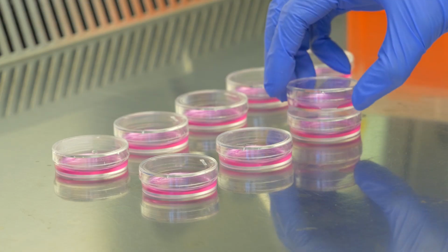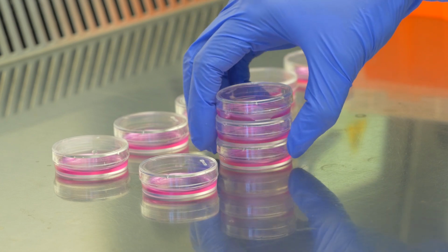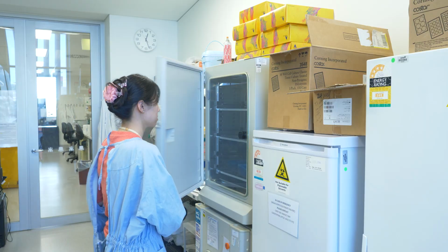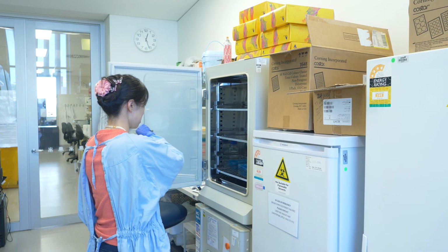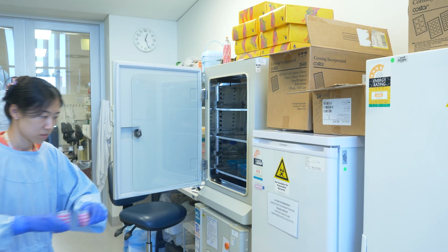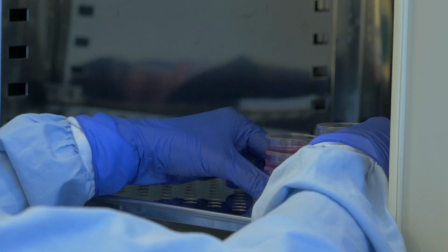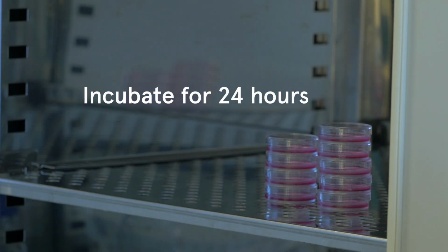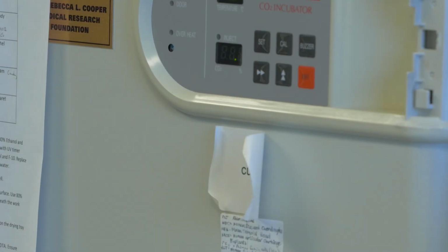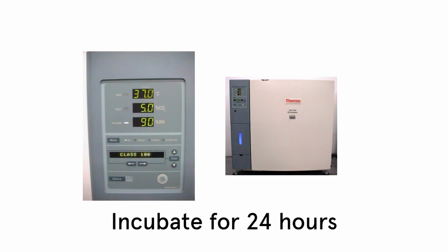Next, the prepared dishes will transfer to an incubator. The CO2 incubator is an essential piece of lab equipment for anyone doing cell culture work. It creates a contamination-free environment for cells while maintaining constant temperature, humidity, oxygen, and carbon dioxide levels. We leave the samples in the incubator for 24 hours. During this time, the cells will attach to the bottom surface of the dishes.